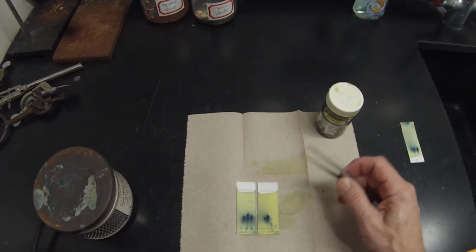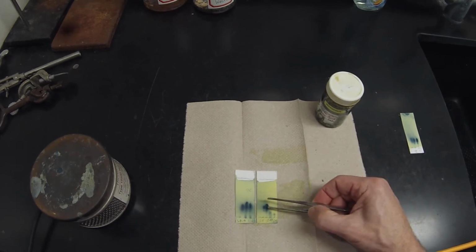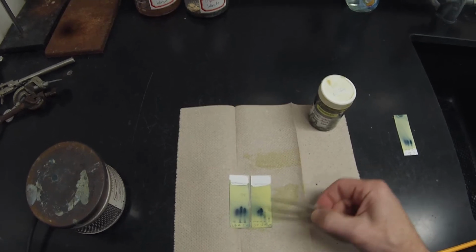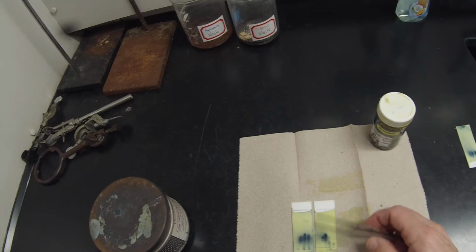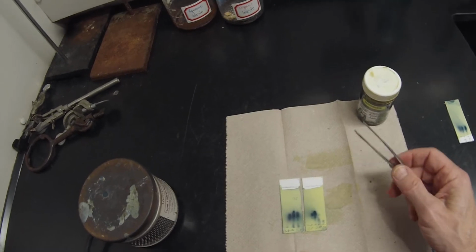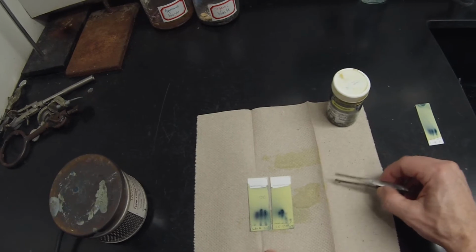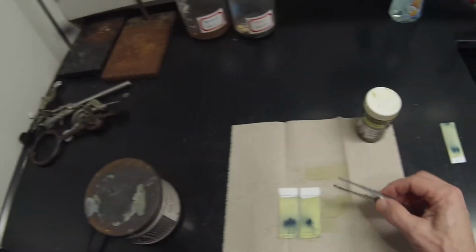A bit of that biphenyl, but I'd like to know when that stops. So I'd like to do 9, 10, 11, and 12, and then I also need to do 14, 15, 16, and 17 to see when that spot stops and starts getting replaced by that bottom spot that we don't really want. I also notice that the ketone's a little bit more purple versus the darker blue of the compound of interest, and I'm not seeing any purple here, which would be a good indication that there really isn't any ketone in the product that's coming off.